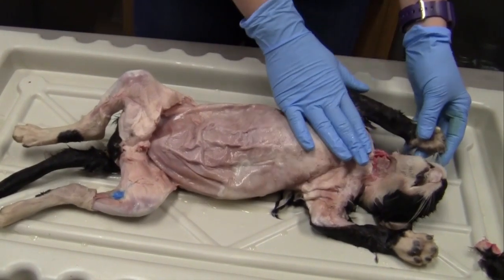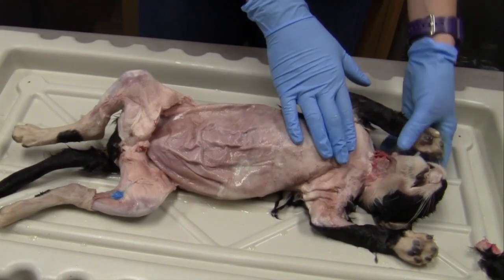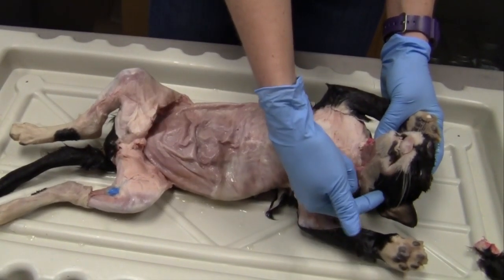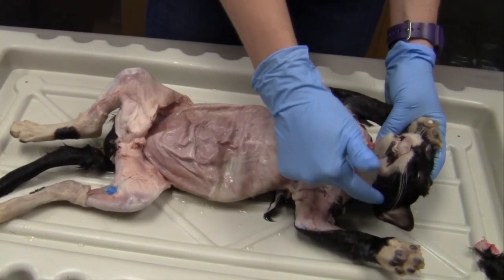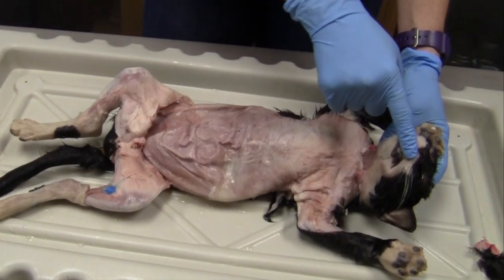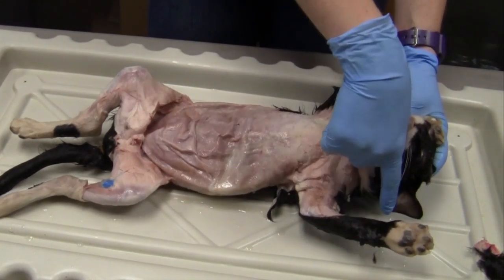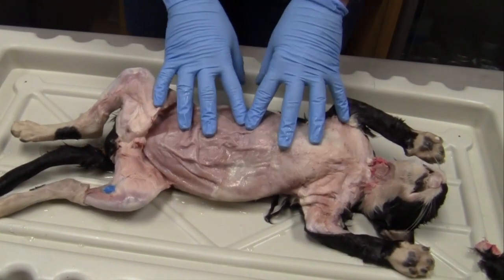And then lastly, you cannot get any more cranial than the head itself, so we have to have some directions on the head. We have rostral, which sounds like nostril, so going towards the nose of the cat. And then we have caudal, which is going away from the nose on the cat.